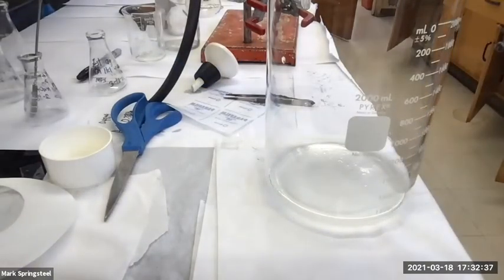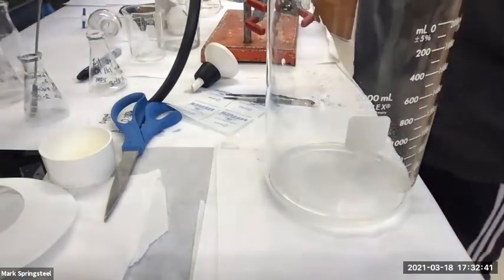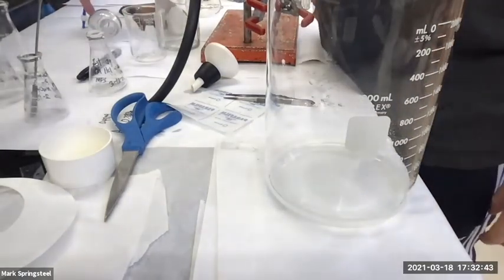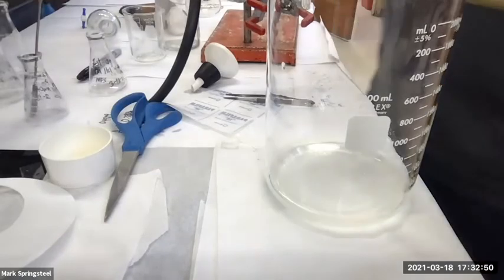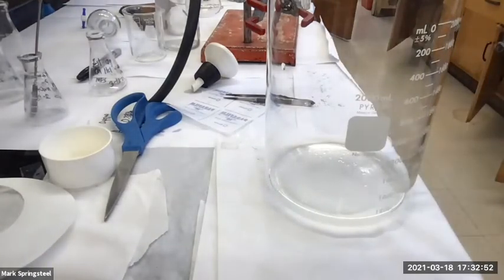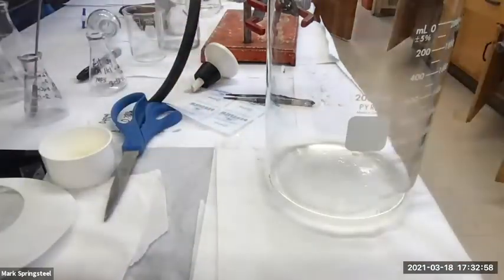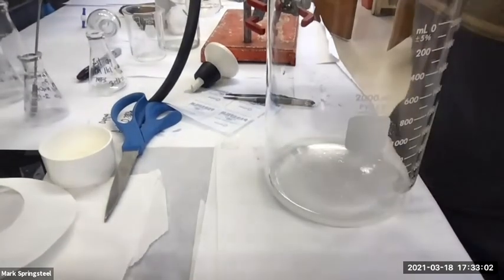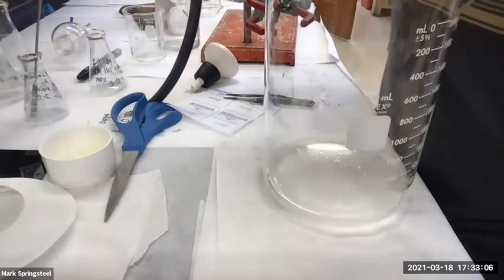Oh, and I just did something that sometimes I don't do, depending on your style. I got rid of that organic layer because I felt very confident it had nothing I wanted in it, but I might have been wrong. I know I got this carboxylic acid. I see the precipitate, it's a lot of precipitate, I'm happy. But the organic layer that's evaporating in the fume hood, I haven't really seen that solid yet. So I was a little bit quick to get rid of this organic layer, but I think I'm all right.